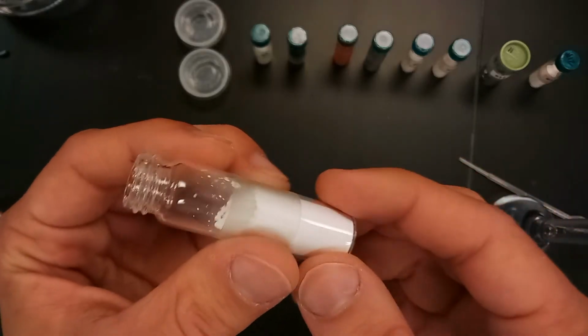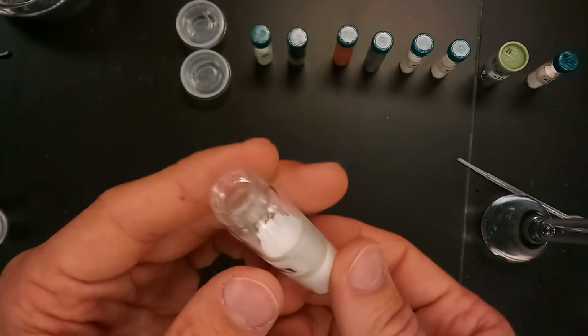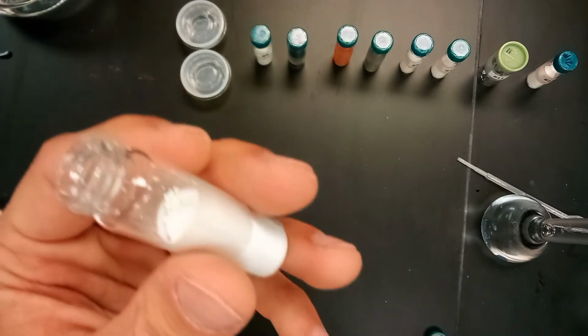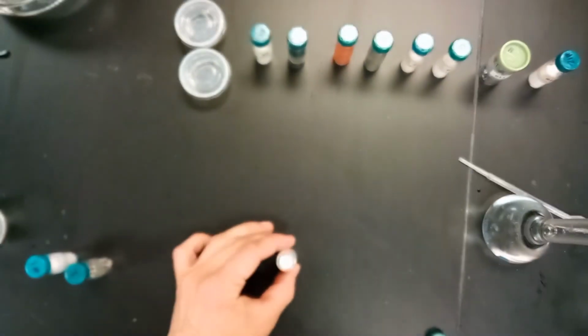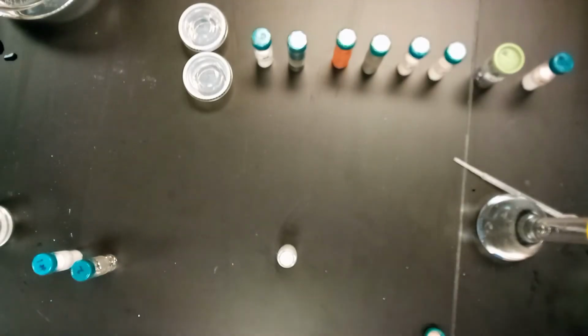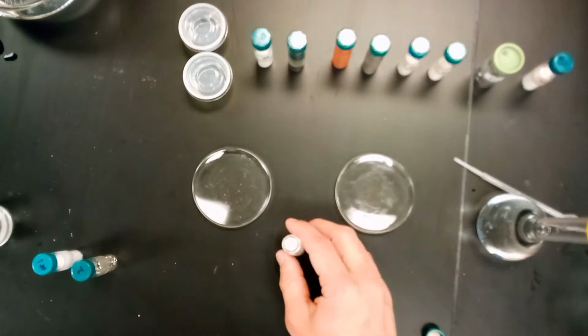Got number 3 here now, which again, just like number 1, is kind of like a white powdery substance. This one reminds me of powdered sugar, though. It's much finer. The other one reminded me a little bit more of sugar. This is powdered sugar, much finer, almost flour-ish. So again, there's a couple things we want to do here. The first thing that we want to do is get its pH level.